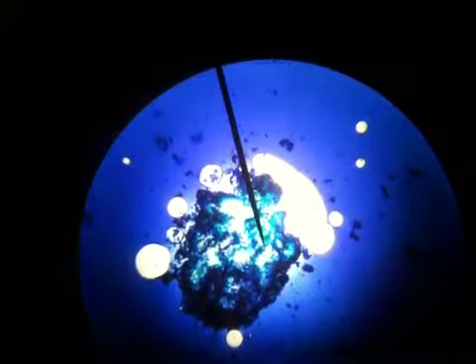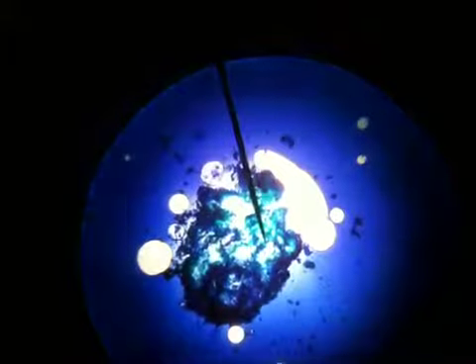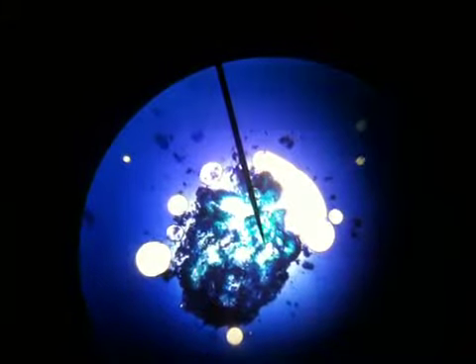And it's hard to see through this video where my focus point is, but let's just say that's focused. Now, that's on my lowest magnification, so that's four times. So if I turn my objective lens to 10x, 10 times.